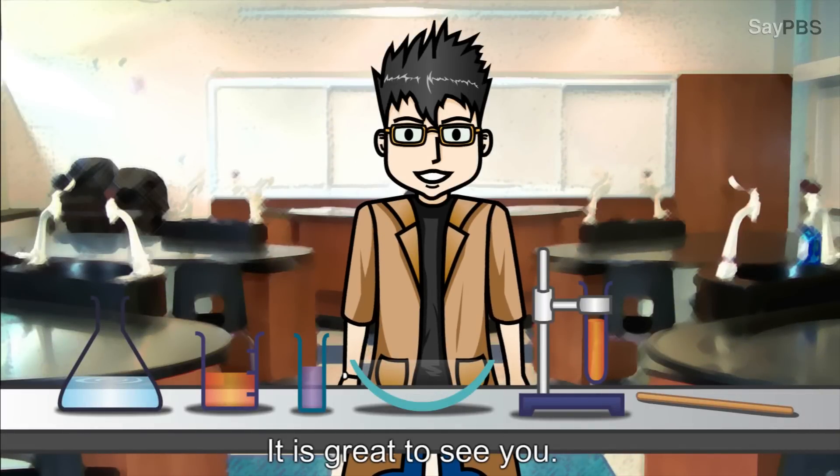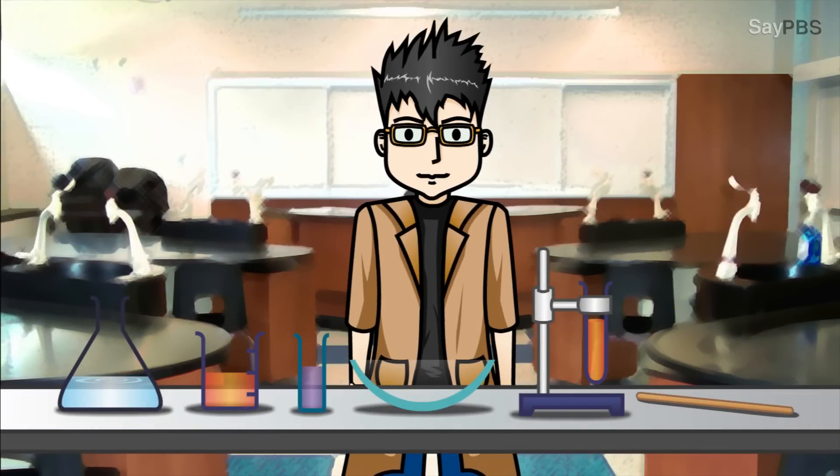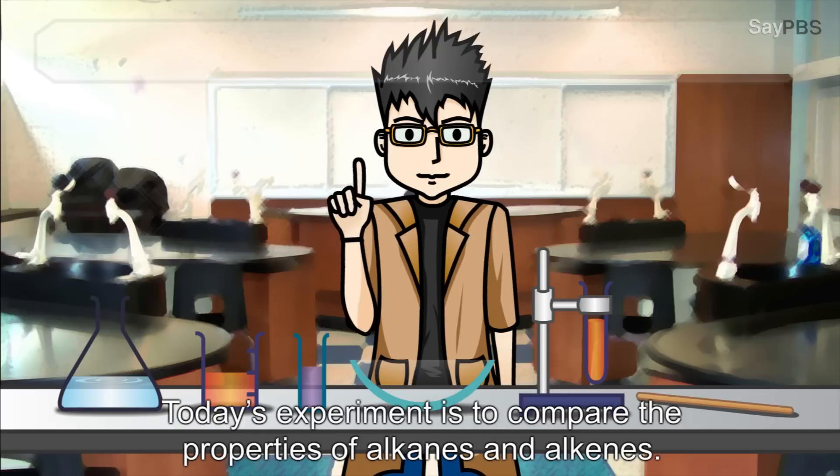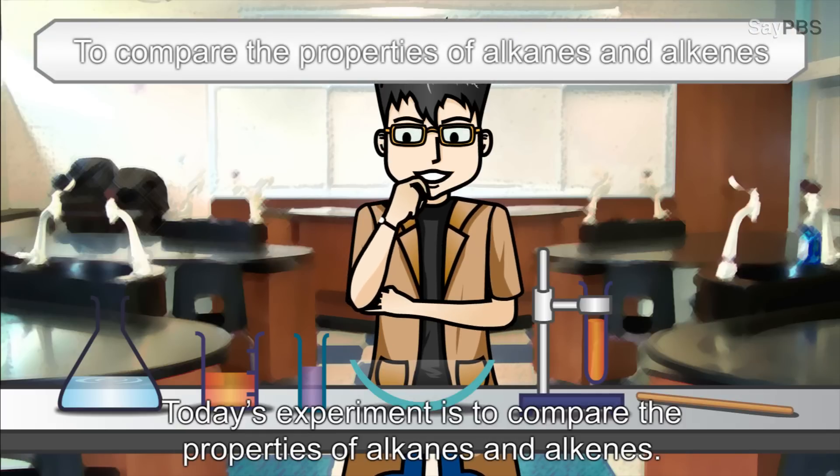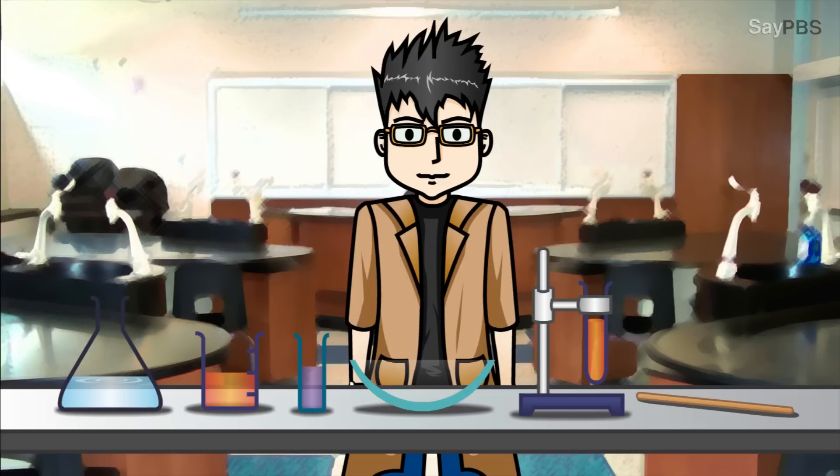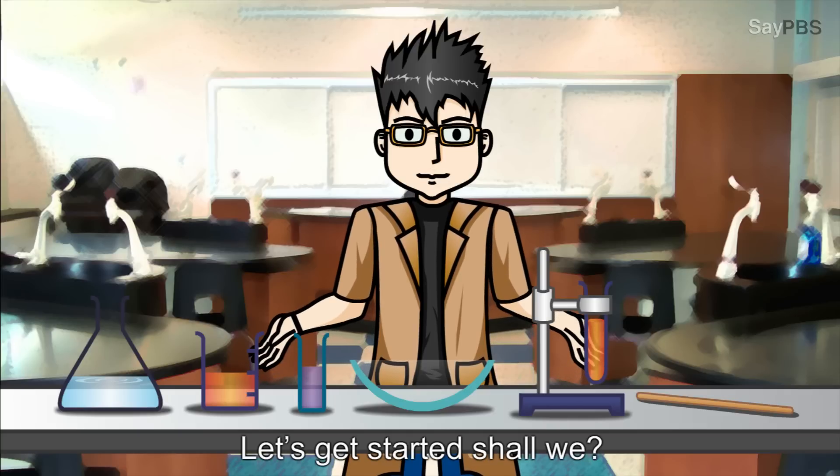Hello again, it is great to see you. Today's experiment is to compare the properties of alkanes and alkenes. Let's get started, shall we?